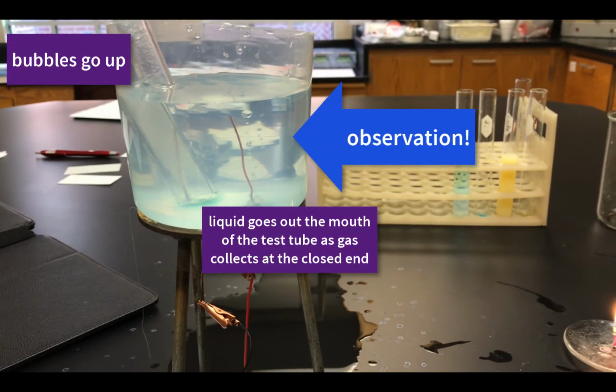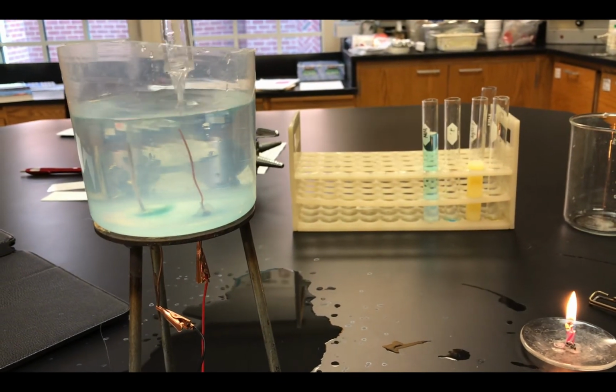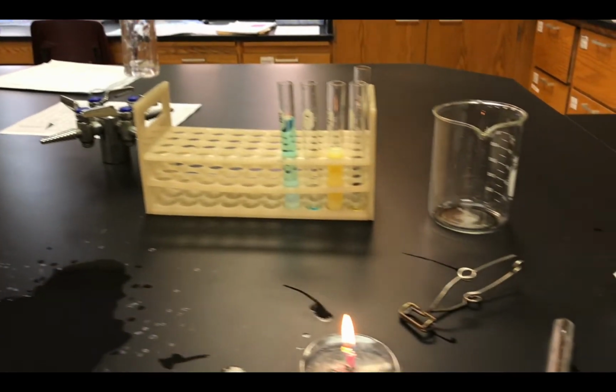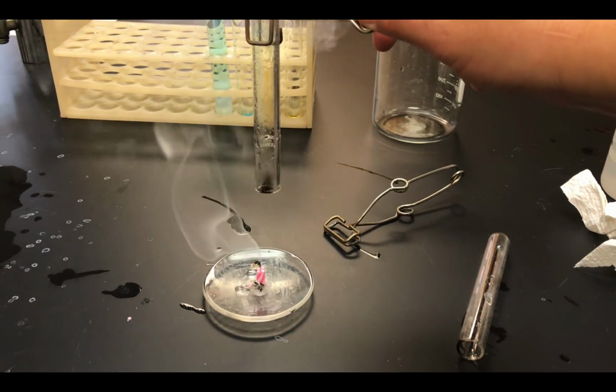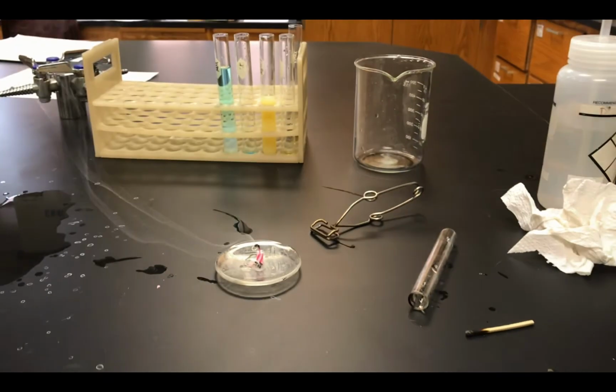Then we'll put it over that gas producing electrode, which means that the gas will collect, right? That's called water displacement, right? The gas will collect at the top, push the water out the bottom. Now we're going to expose it to a flame. Listen carefully. Ta-da! What was that sound?